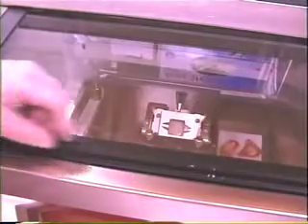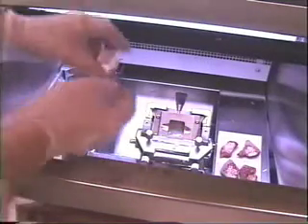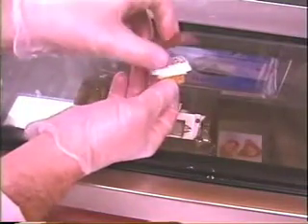Once the array block is complete, you will need to set the punches. To do this, take a room temperature copper plate or other metal plate and place the array mold on it. Remember not to tip the array over when doing this, as the punches are loose and will fall out of their holes.